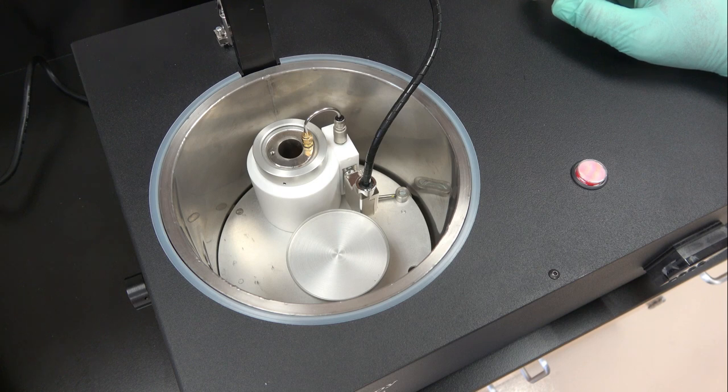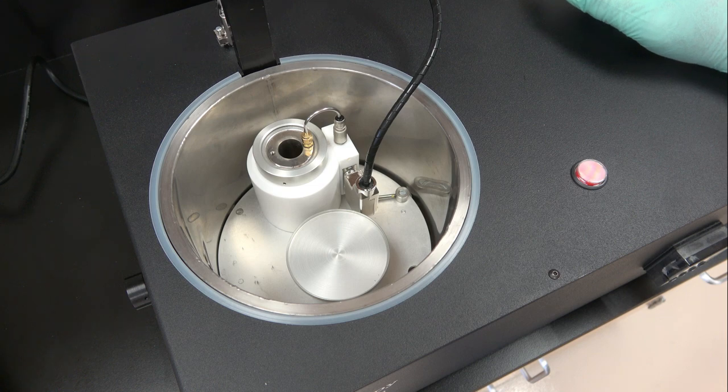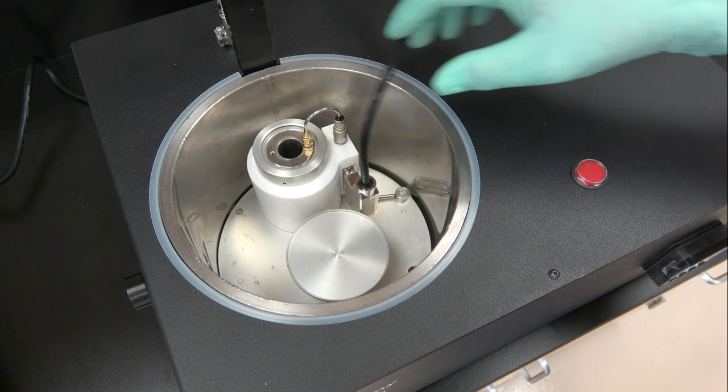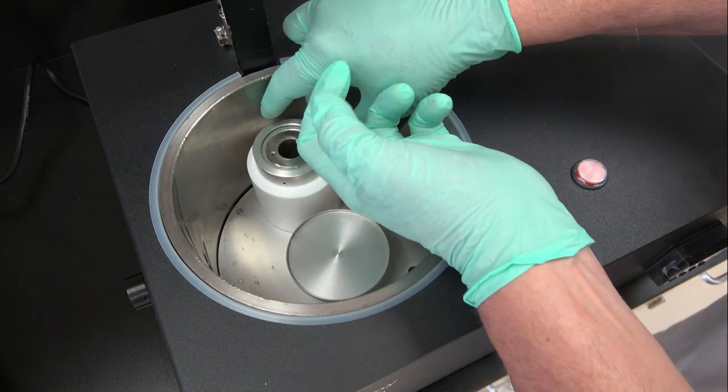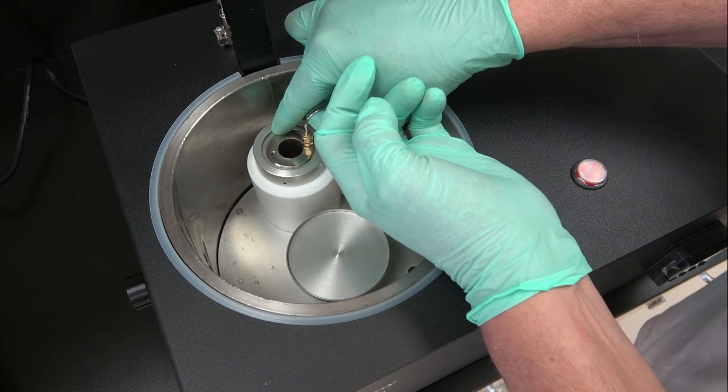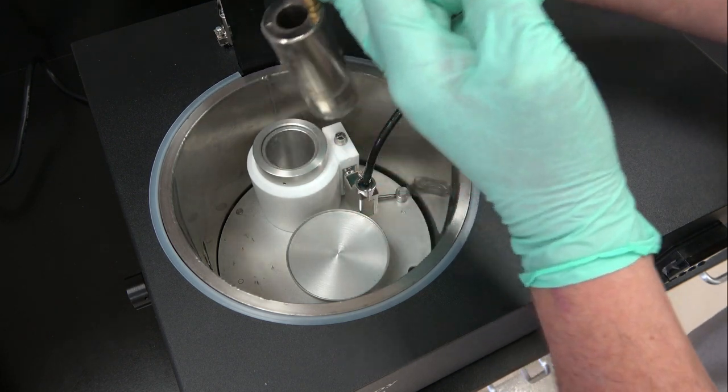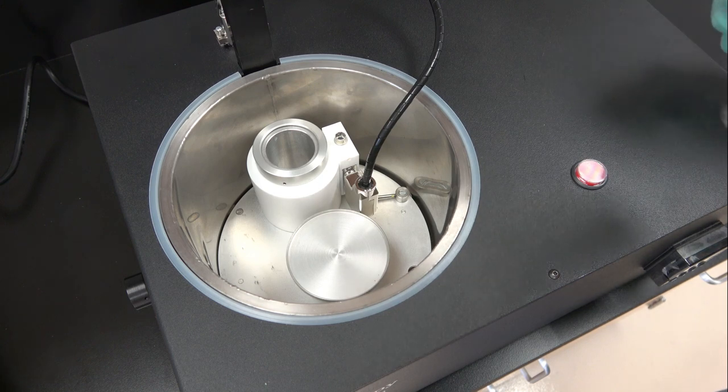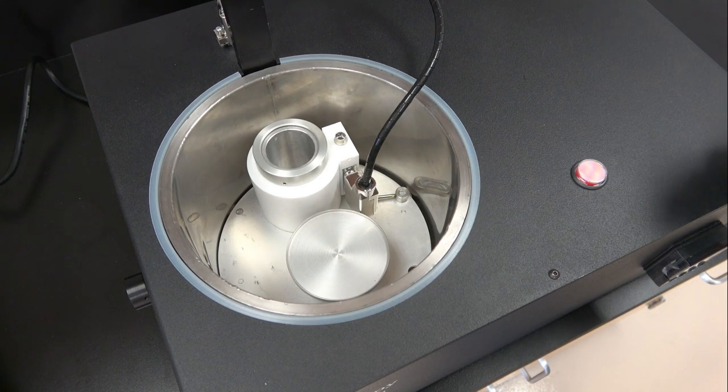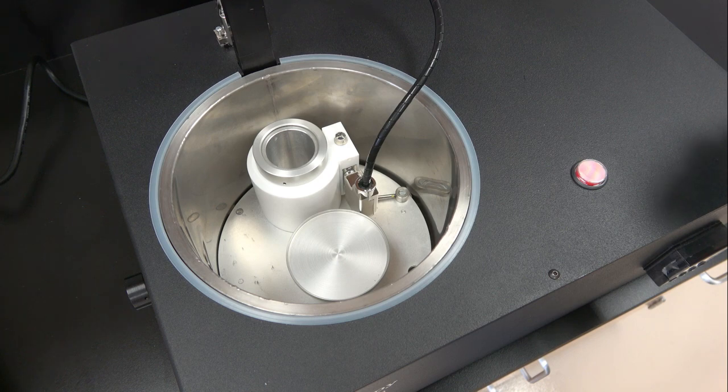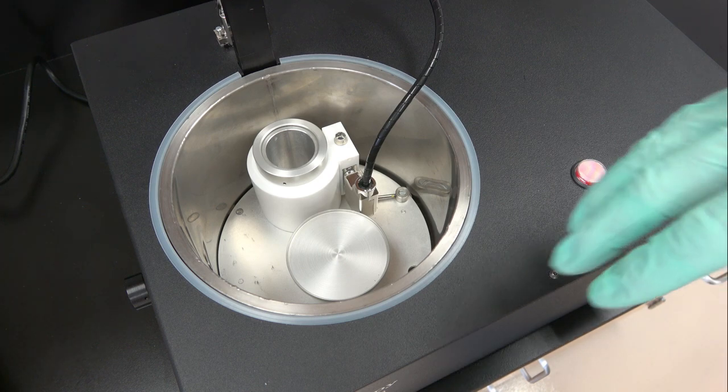You cannot shut this off unless you shut the power off. The whole idea is for you to then remove the condensation chamber from the unit and then pick up that whole unit and put it in a fume hood and let it come to room temperature overnight.